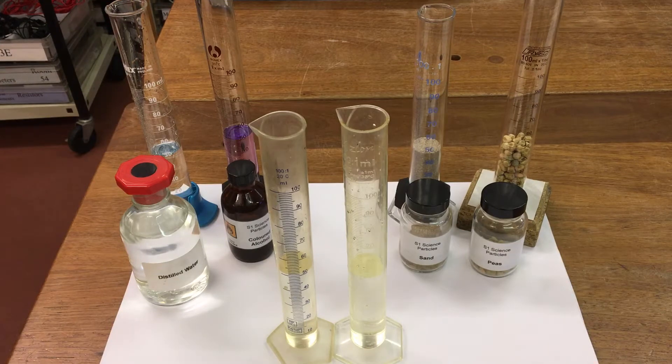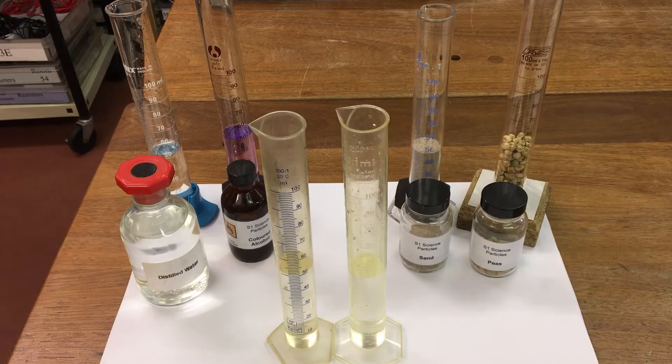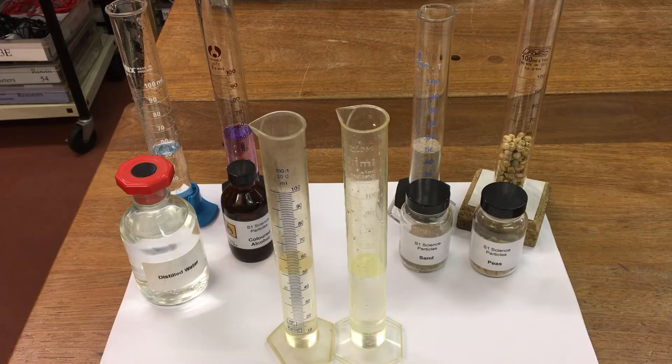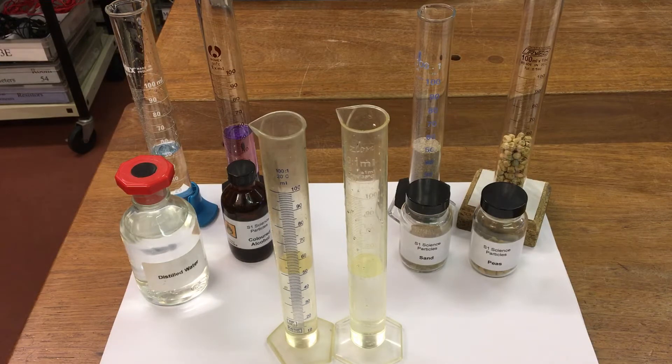In this experiment, we're investigating the spaces between particles in a liquid. First of all, we're going to look at water.